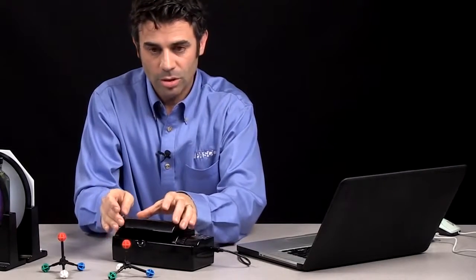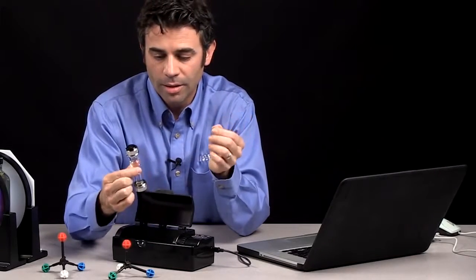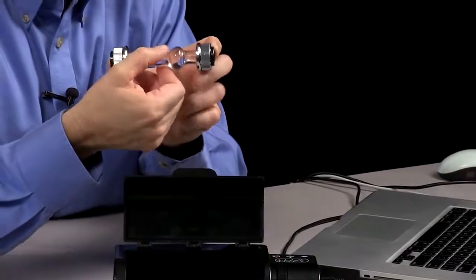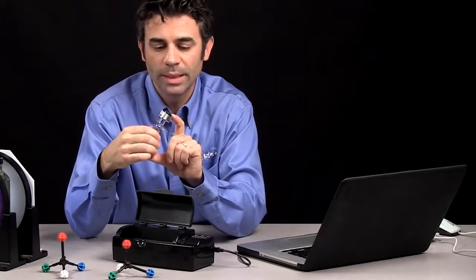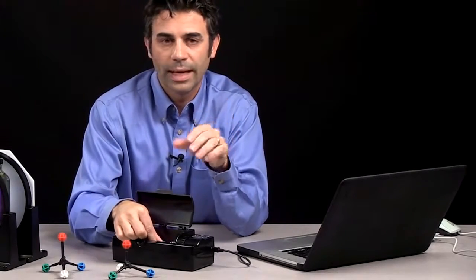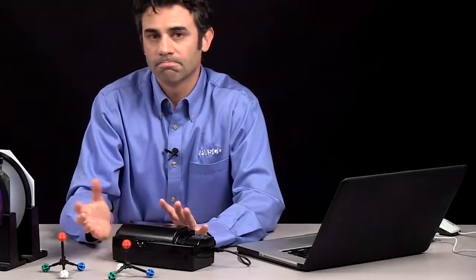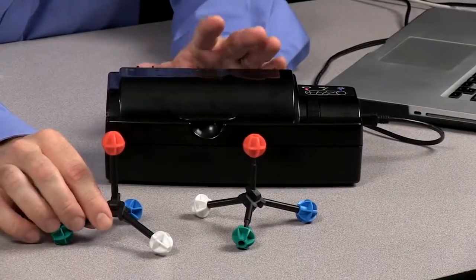The other nice thing about this is that you can do this with multiple concentrations. This is actually a good way to introduce concentration. The specific rotation of your sample will depend on the path length, which we've used industry standard sample cells to make sure you have a very specific path length. And it'll also be based on the concentration of the sample. So you can look at concentrations of samples as a function of optical rotation as a novel way to introduce concentration. The polarimeter is a great way to talk about concentration, and it's also a great way to talk about the differences in molecular structure.